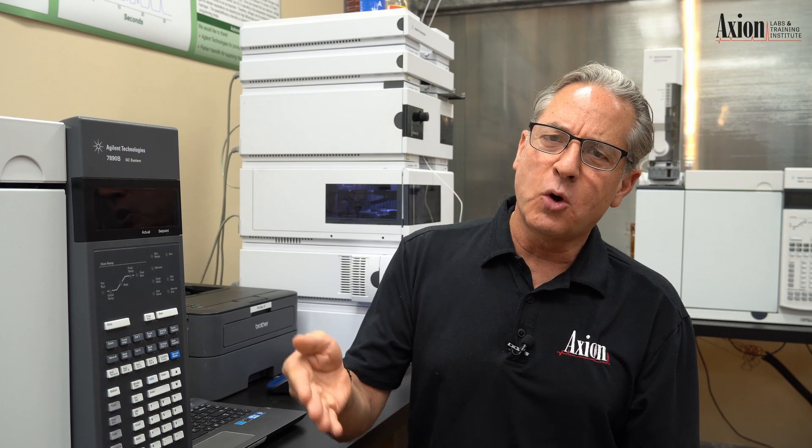Let me deal first with the negative peak concept. If you look in troubleshooting books, they will not help you at all - they'll lead you astray. If you look up negative peaks, it'll say your analyte is absorbing less than your mobile phase, which is totally impossible. Your mobile phase should absorb zero, and anything you're looking at can't absorb less than zero. So we should not get a negative peak due to absorbance.